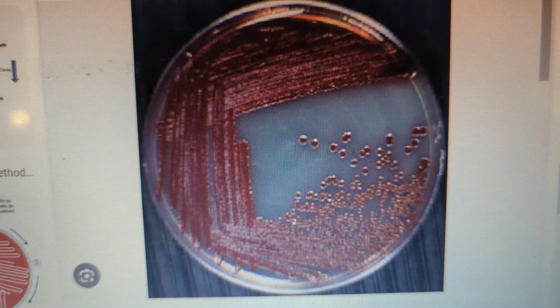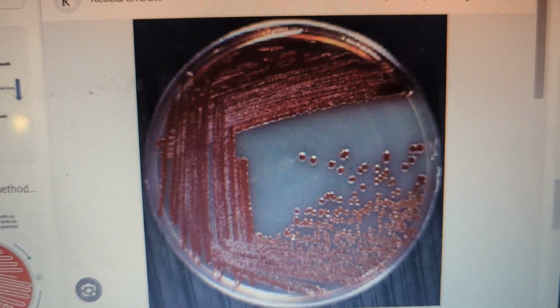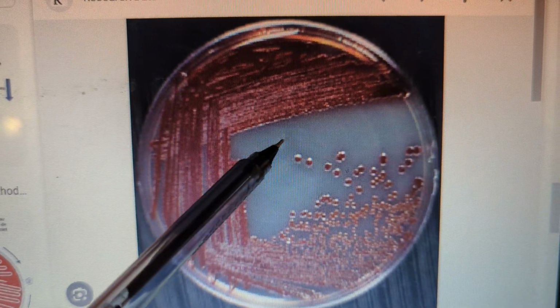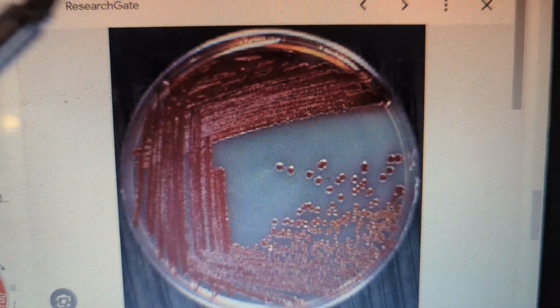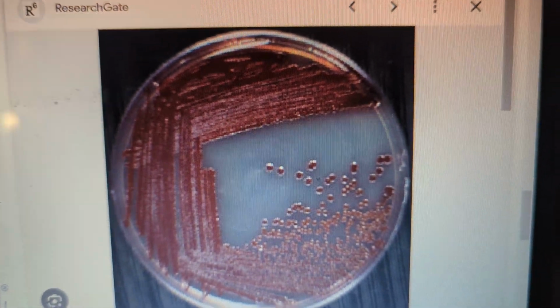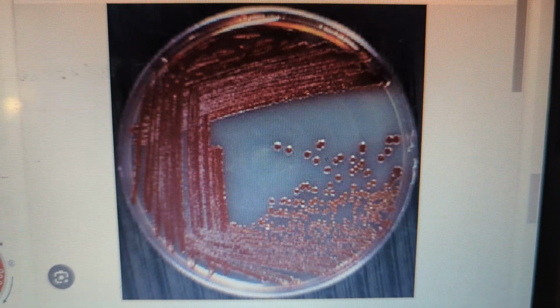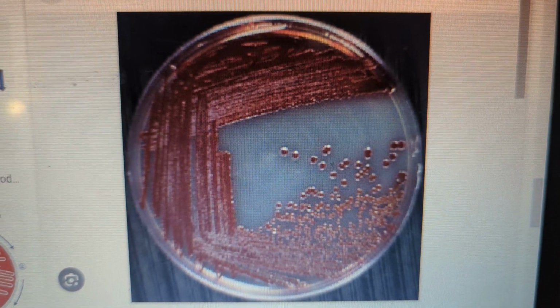Density, well, you have to hold it up in the light. Okay, there's that description: hold it up in the light, and then you see if light is passing through the colonies or not. This agar would probably be described as opaque, most likely, from what I can see. Since we're not holding it up, it's not a real experience, but just to get the idea of the descriptions that we use to have the colony characteristics.